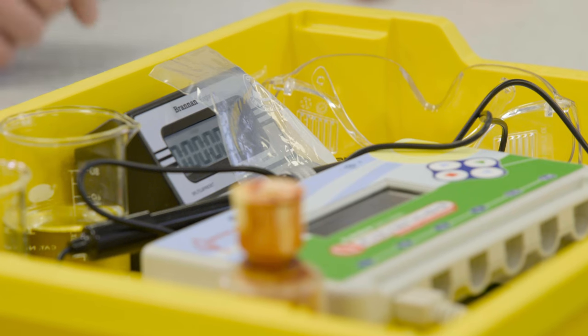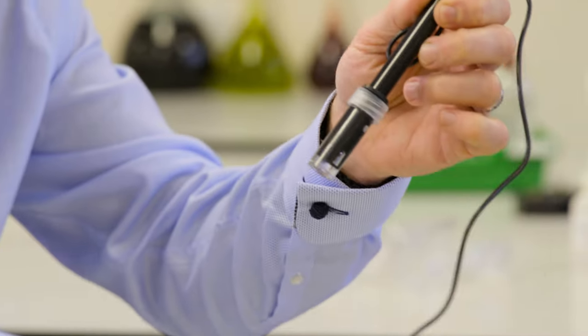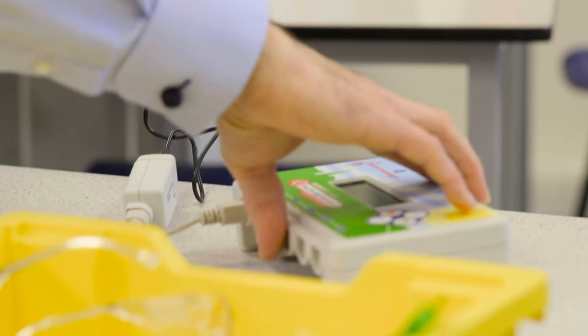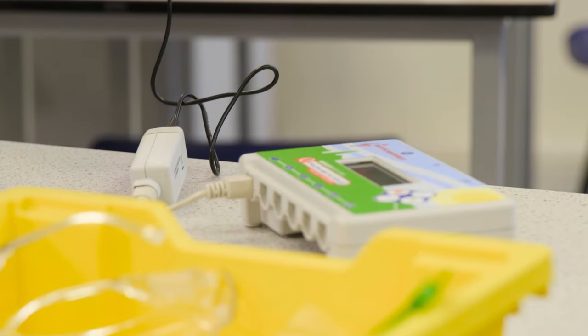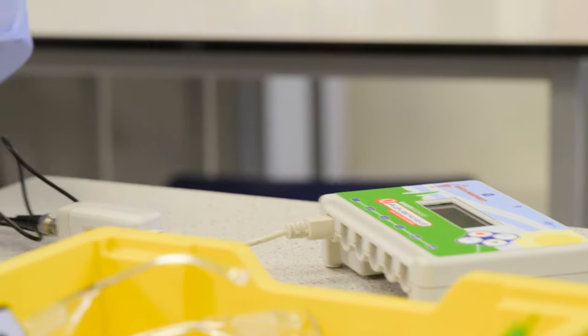If you've got pH meters, by all means try them. Maybe do a comparison between those and the universal indicator, or just do the universal indicator.